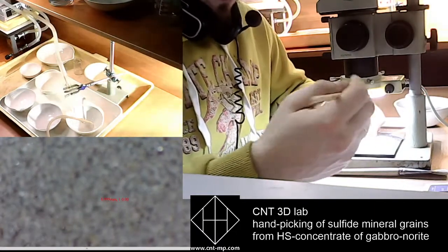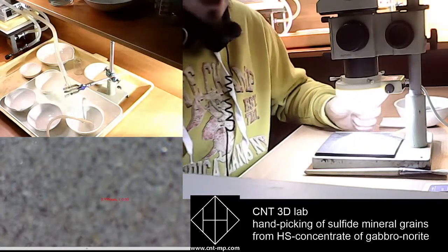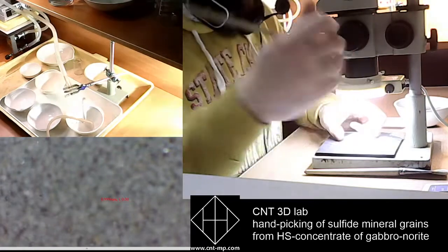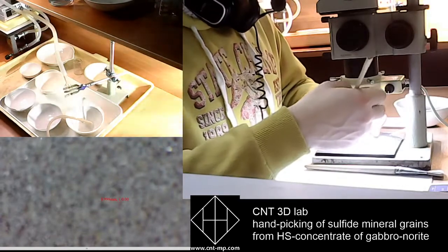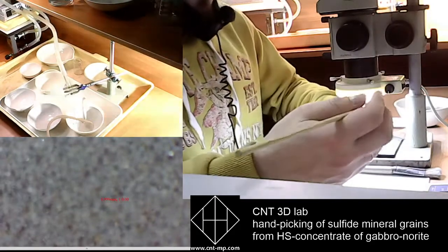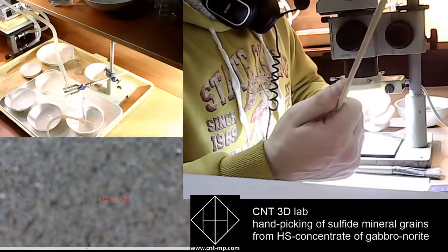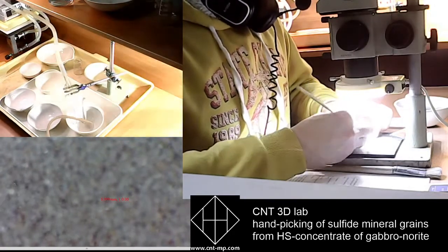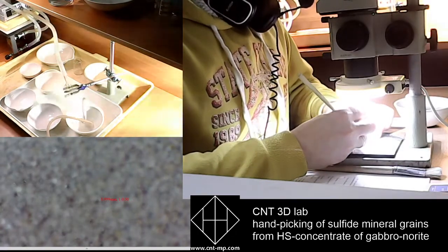So these will be either volume grains on carbon scotch tape, duct tape, sorry, or monolayer polished sections for scanning electron microscopy and electron microprobe microanalysis, as well as for laser ablation ICP-MS analysis. Alternatively, we can send them, for example, for XRF, X-ray fluorescence, or X-ray diffraction analysis as powder specimens.